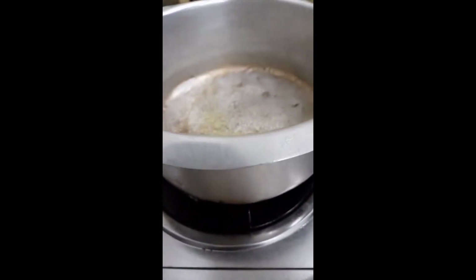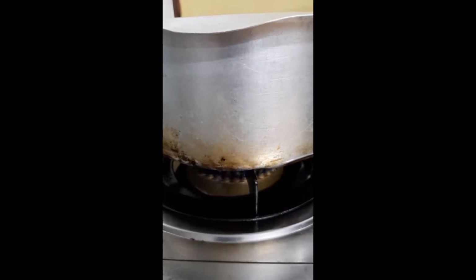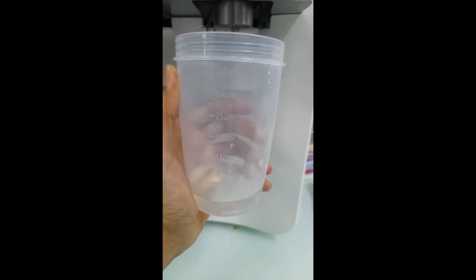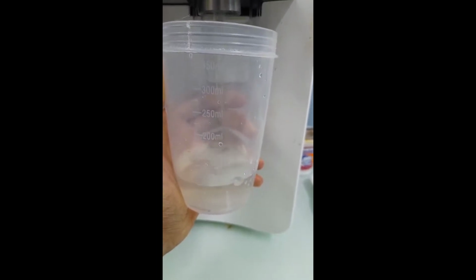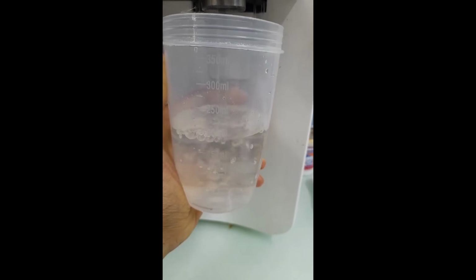After the potato has become soft, we turn off the stove and let the potato infusion cool down. After that, we collect the potato extract by sieving it through a clean cloth sieve. Now, we measure the amount of potato extract collected and adjust the volume to 250 ml by adding water. Put the solution aside as we will use it for the next part.